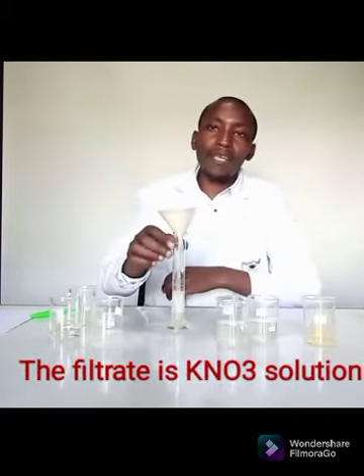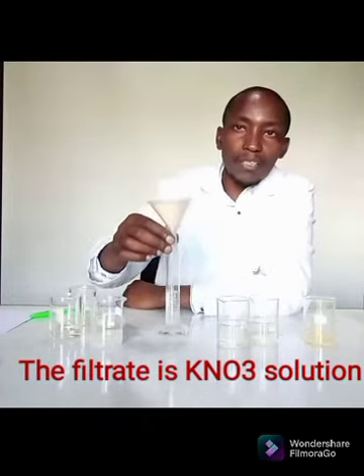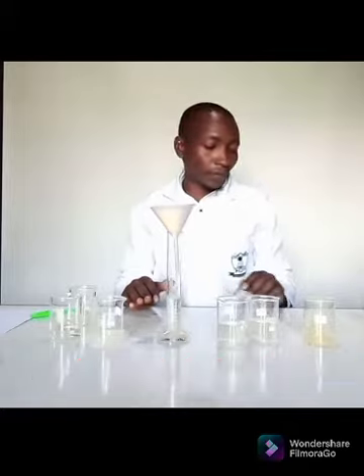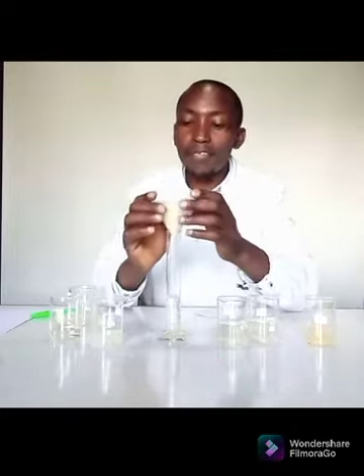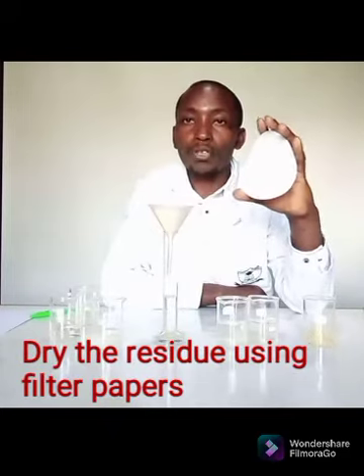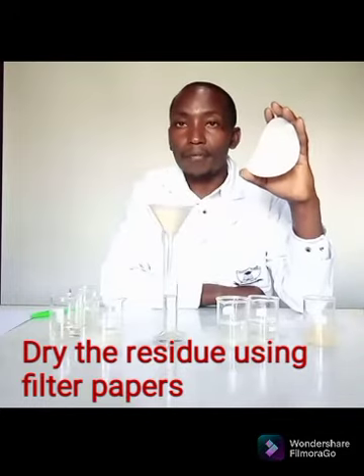The solution that I'm getting here, you can see it's a very clear solution. That is potassium nitrate. And of course, you know, potassium nitrate is a very soluble salt. Once I have the precipitate filtered, I'm going to use a filter paper to dry the PPT. So I'm going to give it time, then I will do the drying.